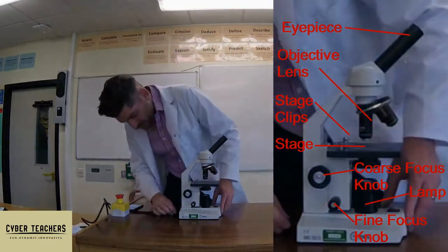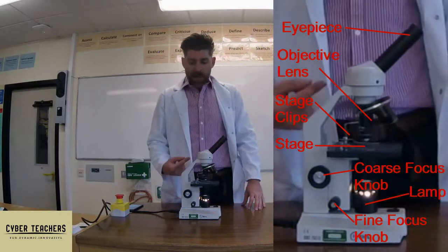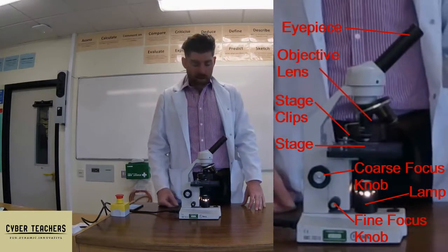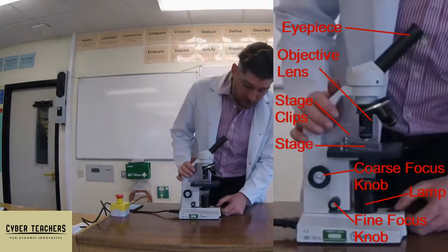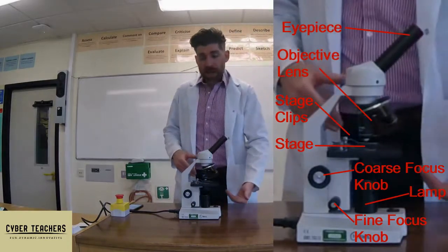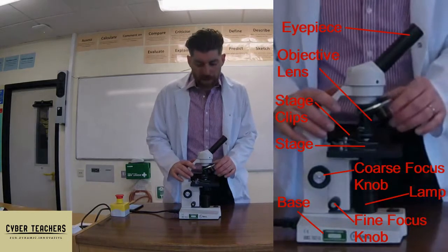Down here we've got the lamp. When plugged in, the lamp turns on and shines light up through the specimen and through the slide. This is a microscope mainly for very thin specimens that you can shine light through. Be careful because these lamps get hot. Some older microscopes might not have a lamp — they might have a mirror to redirect light from outside — but more modern ones do have a lamp.